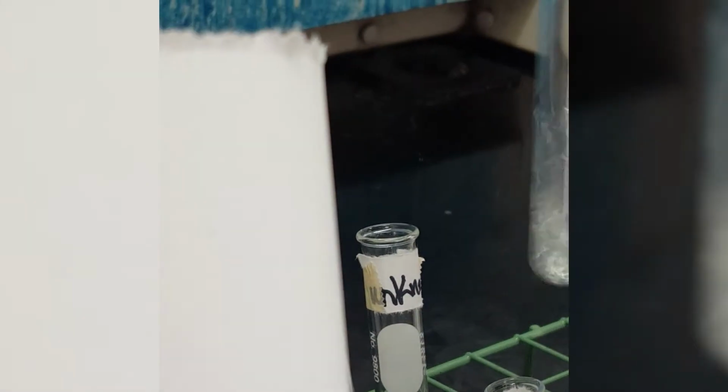Now this is cyclohexane in Ligroin. Do you see two layers? Is it soluble? If there are no two layers, then you have cyclohexane being soluble in Ligroin. Make your determination. Come up with your observation.